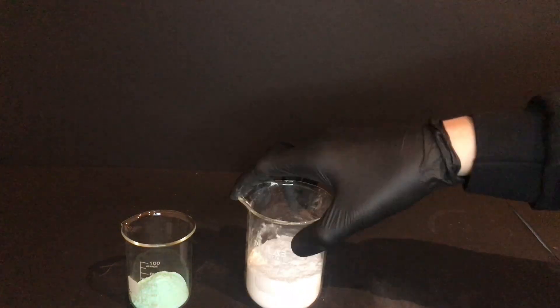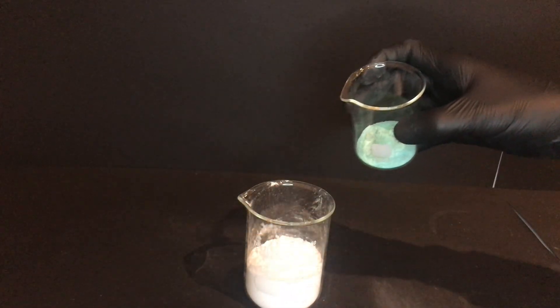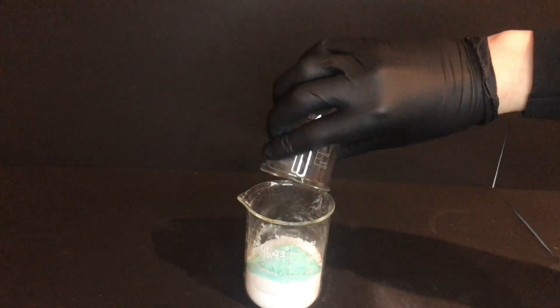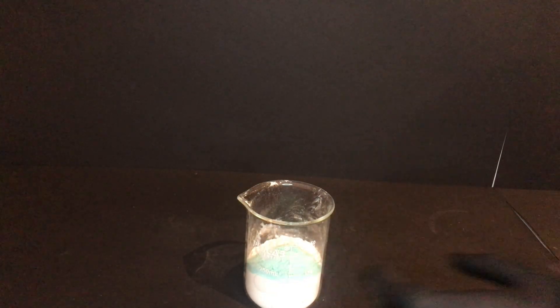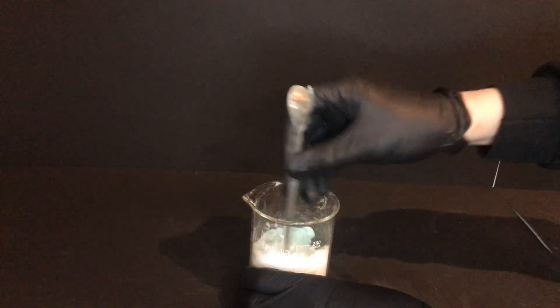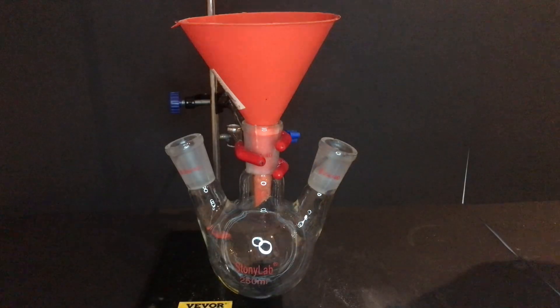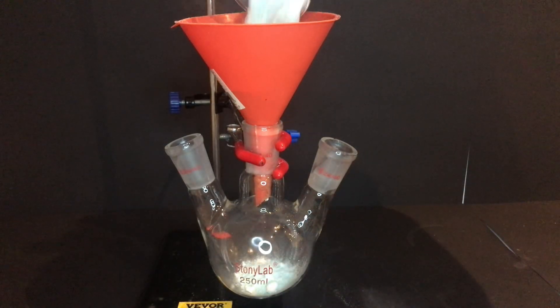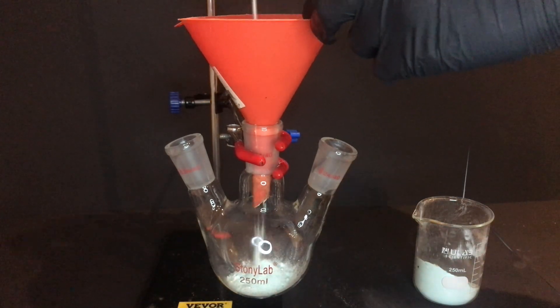In the pyridine synthesis we only need two reagents: 50 grams of nicotinic acid and 13.6 grams of basic copper carbonate. These two reagents were mixed thoroughly and put into a 250 ml boiling flask.